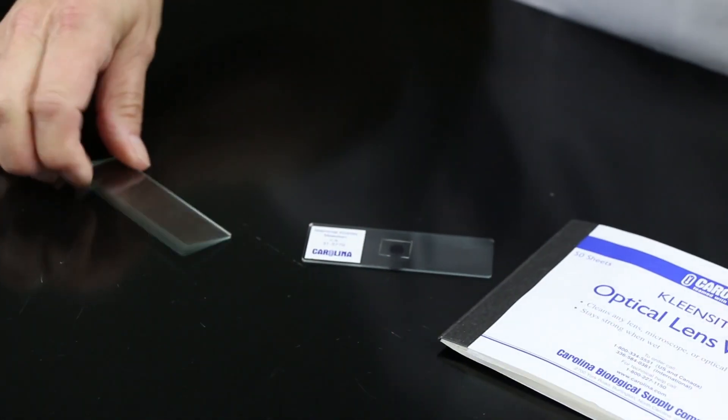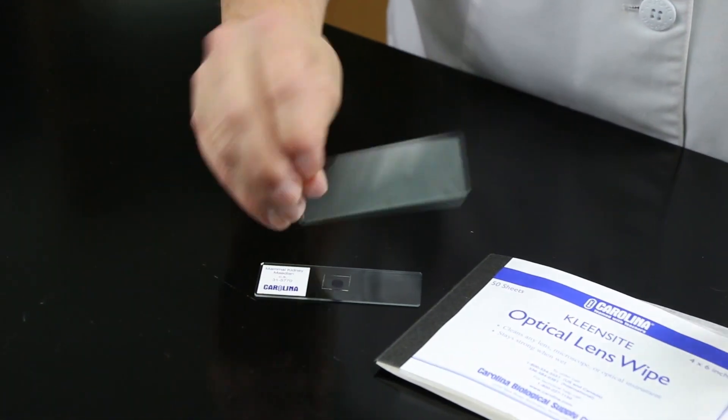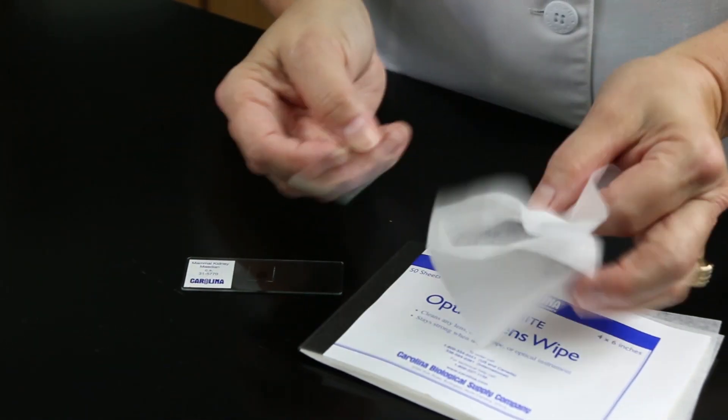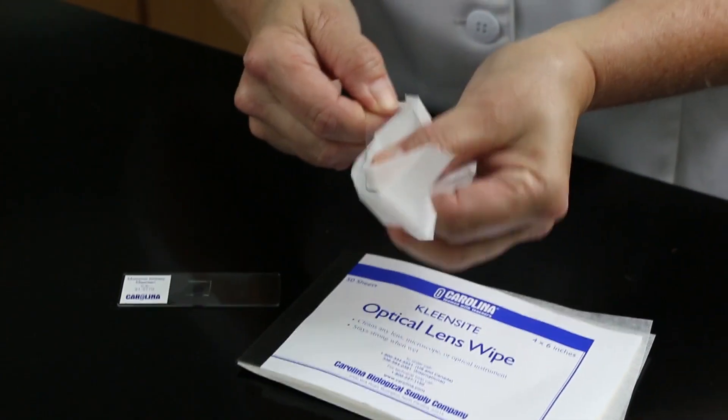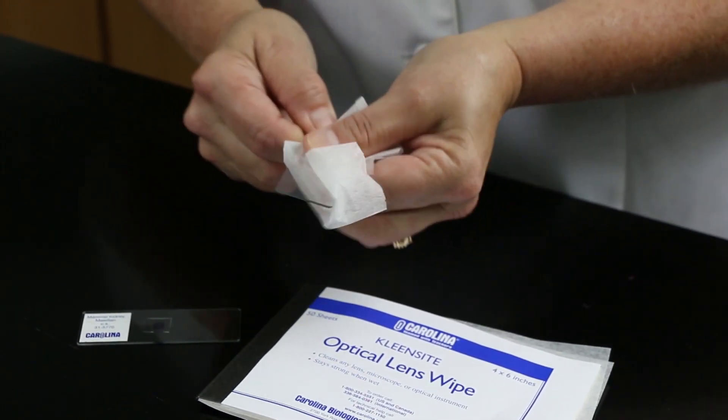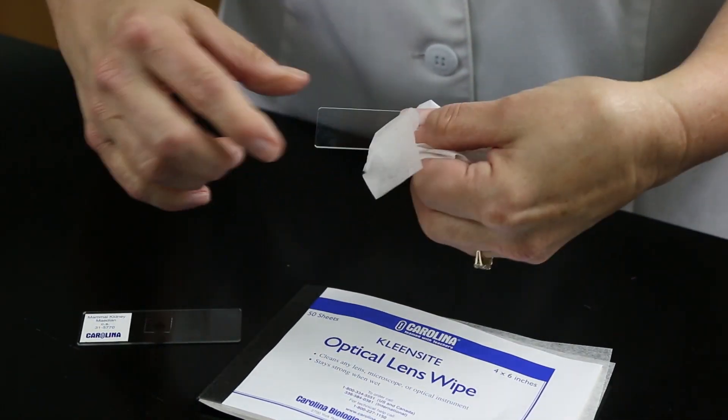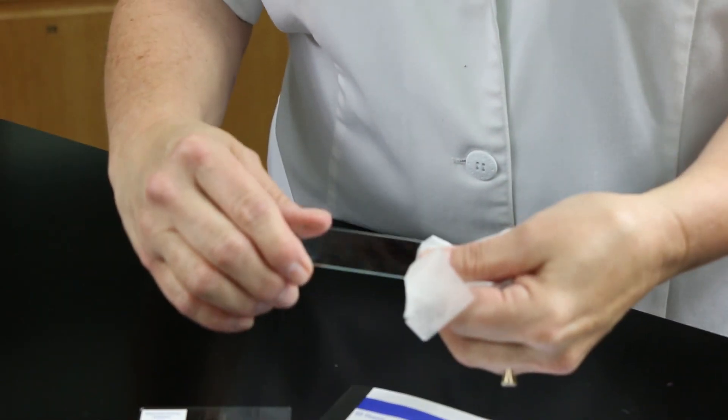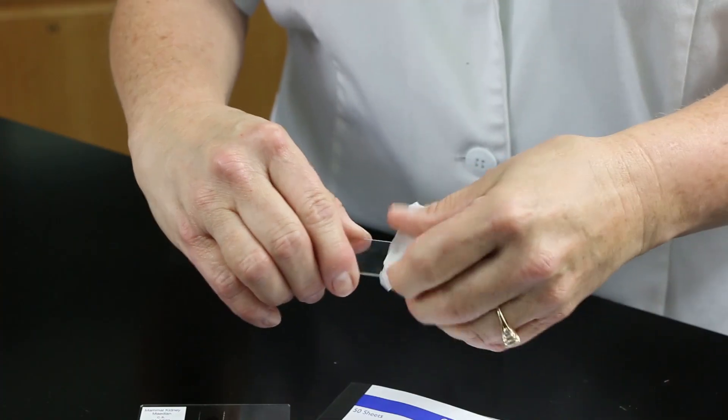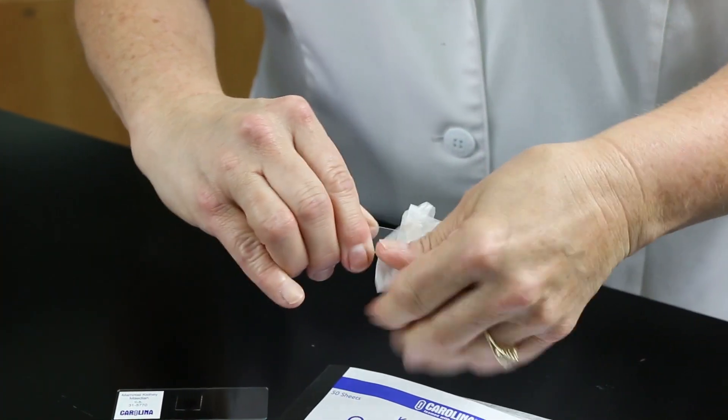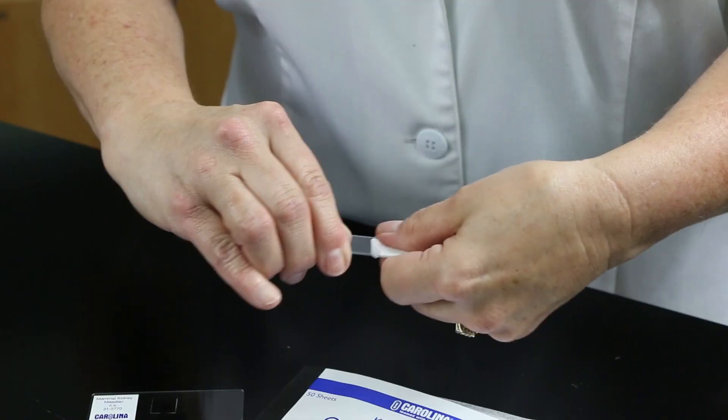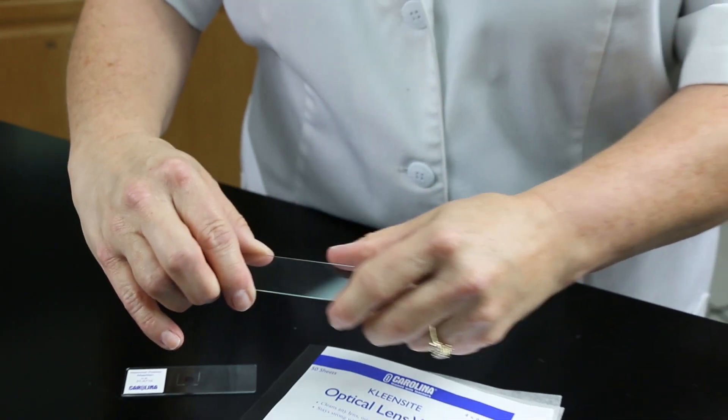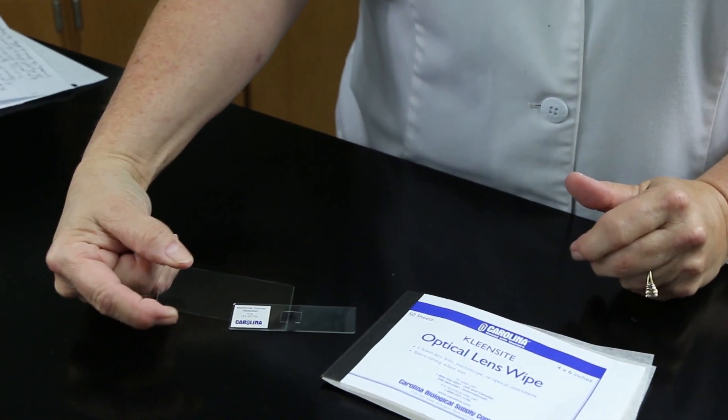When you're using the blank slides for some reason, then sometimes they come out of the box and they're blurry too. So you can again use these wipes to rub the slide. Be careful while I'm doing this, or while you're doing this, because the slide is very sharp. So you want to make sure that you avoid touching the sharp edges in a way that would be harmful to you. And then the slide is ready to go to make a wet mount.